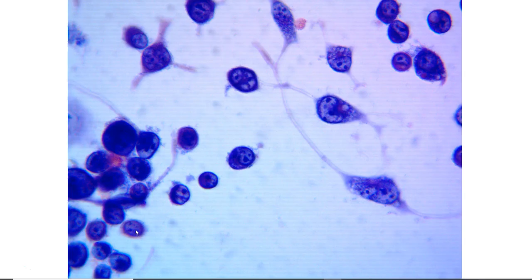Last example, sometimes we are looking at cells that are maybe of neuronal lineage. So we work with mouse neuro 2A neuroblasts sometimes, and we try to differentiate them into neurons. In that case, we are not only going to be looking at the cell bodies, but also these processes that are forming. And we may be measuring their length or how many times they are dividing, so if they are just clean single or if they are actually dividing further to make connections. So there'll be other morphological things that we are going to be looking at as well.